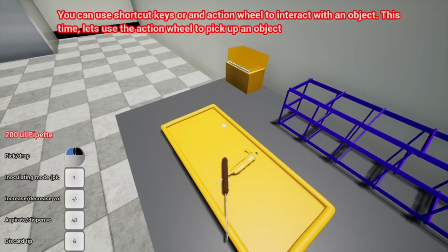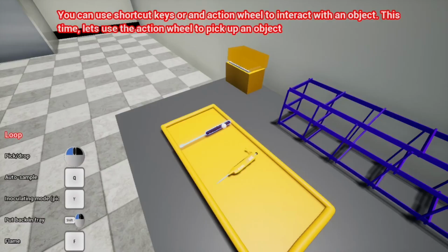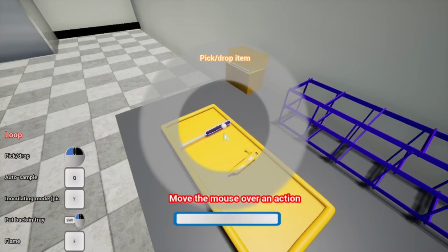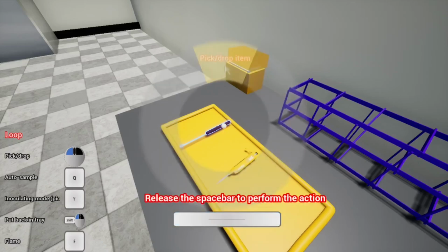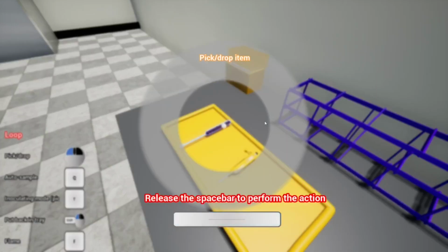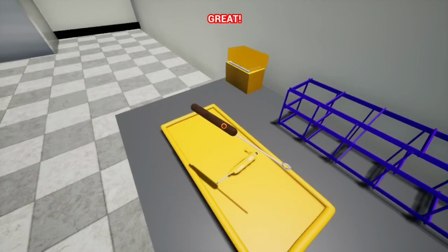You can use shortcut keys or an action wheel to interact with an object. This time, let's use the action wheel to pick up an object. Press and hold the spacebar button to see the action wheel. Gameplay is paused, so you can't do anything right now, so don't worry. Move the mouse over an action, and let go of the spacebar to perform the action. Now it's asking you to start. If you get stuck over here, you can restart, but let's do it. Just press spacebar, use the mouse to go over the action, and then let go of the spacebar. Don't click anything. Great. There we go. You are getting the hang of this.